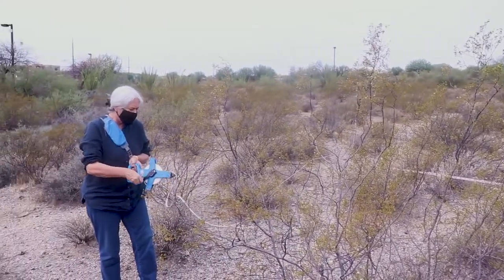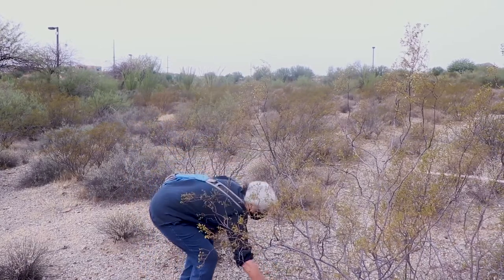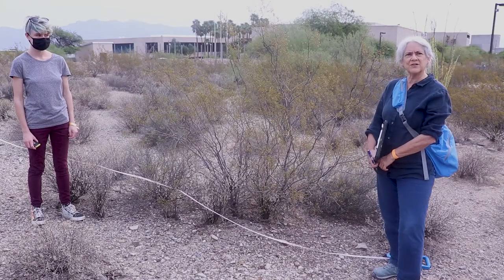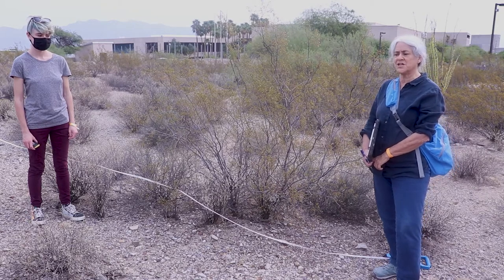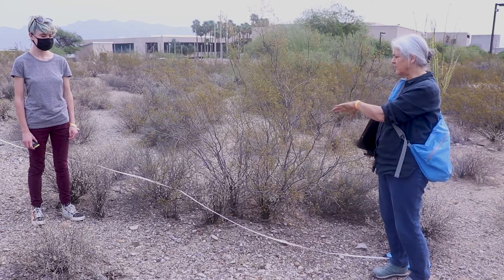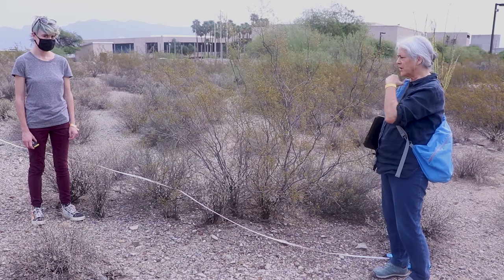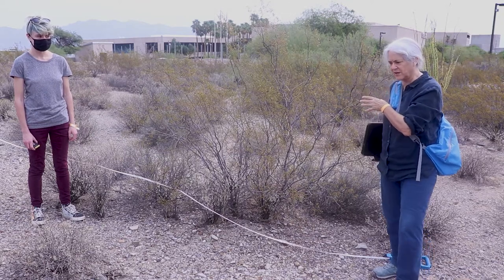So now since there's just the two of us here, I'm going to put this down on the ground — this is meter one for the start of our tape right here. We've laid out our transect, it's 20 meters long. Now what we're going to do is assay the plants that intersect with or intercept the transect line. That means any plant with vegetation hanging over our transect line, or any plant where the transect line is laying over the top of the plant, we'll identify. We're going to identify each plant that fits those criteria.